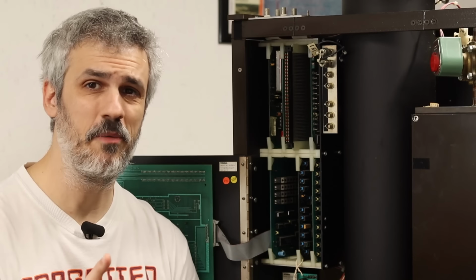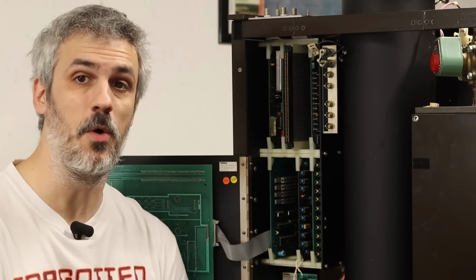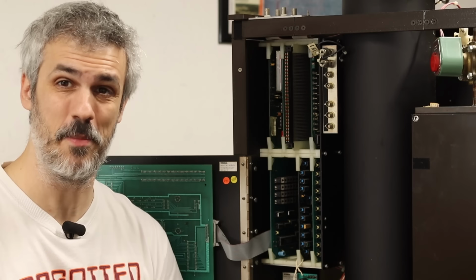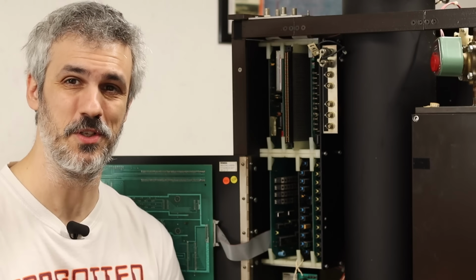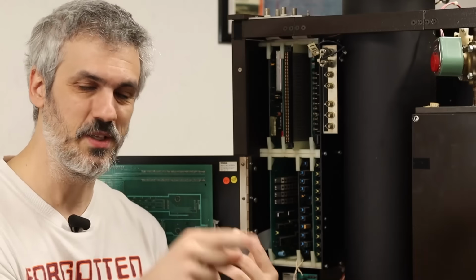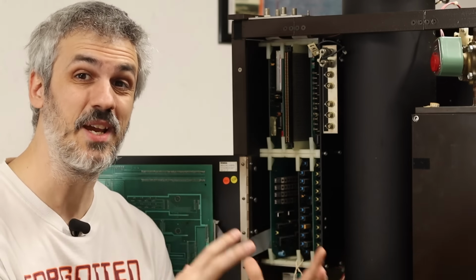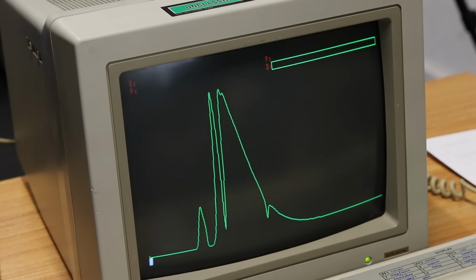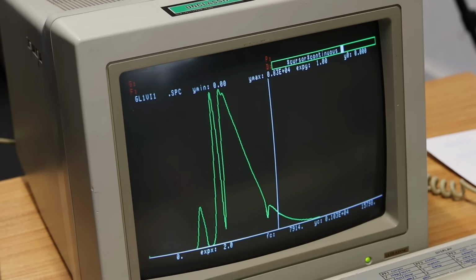We've spent the last couple of episodes diving in deep on this Bomem DA-3, and if you're curious about what a spectrometer is and how spectroscopy works in general, I highly suggest going and checking out those episodes. I dive into a whole lot more detail on the concept of spectroscopy. So in this episode, what I really want to do is get this plugged into the PDP-1173 so we can take control of it from the PDP and start getting interferograms out and start building spectra of things.